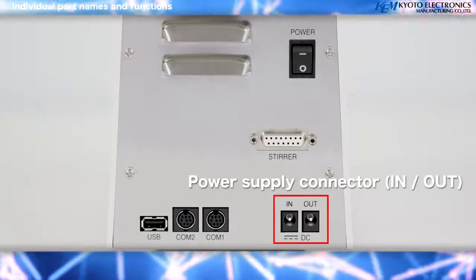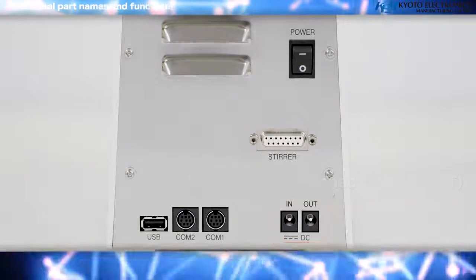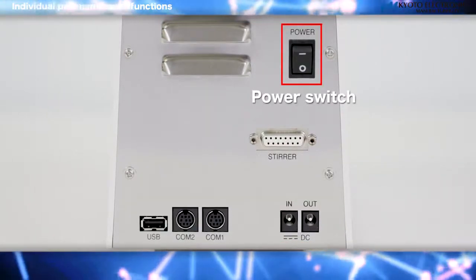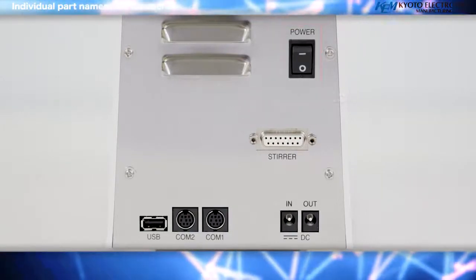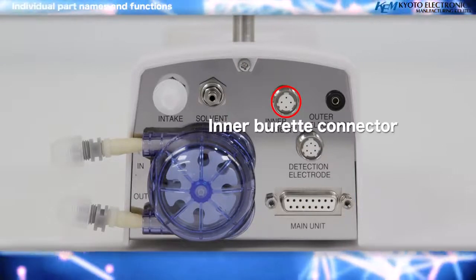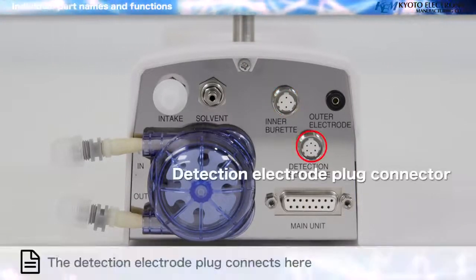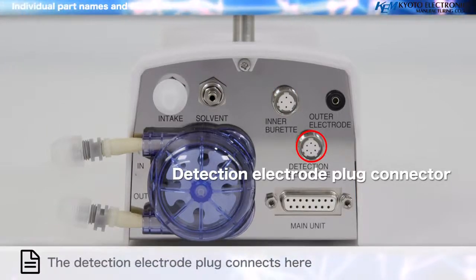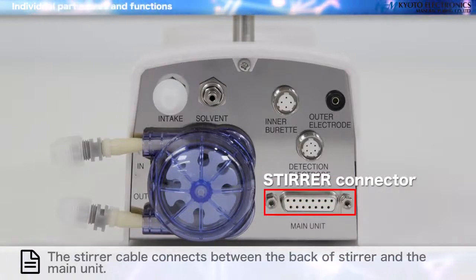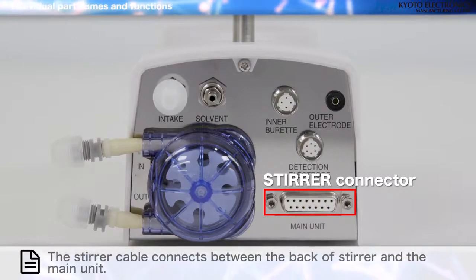Power supply connector, in, out. The power cord connects here. Power switch. This switch turns the power supply of the device on and off. Inner burette connector. The inner burette plug connects here. The detection electrode plug connects here. Stirrer connector on the stirrer end. The stirrer cable connects between the magnetic stirrer and the main unit.